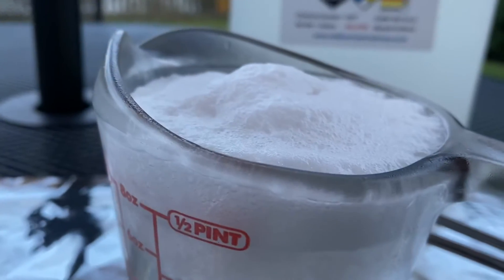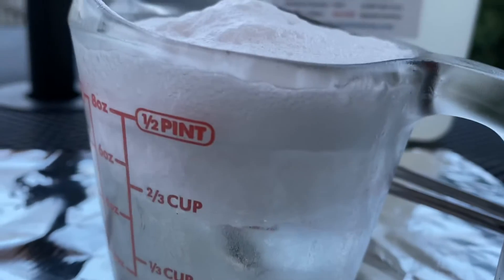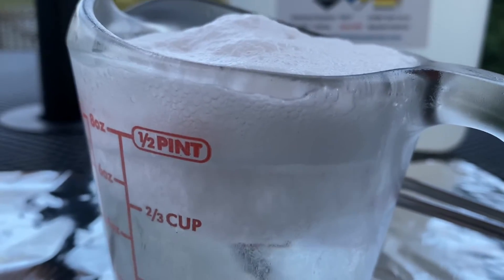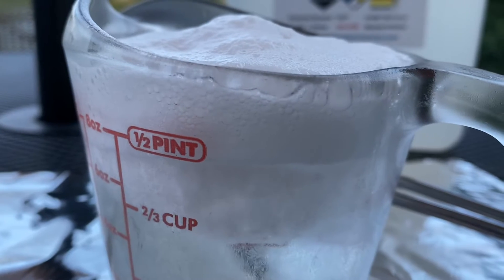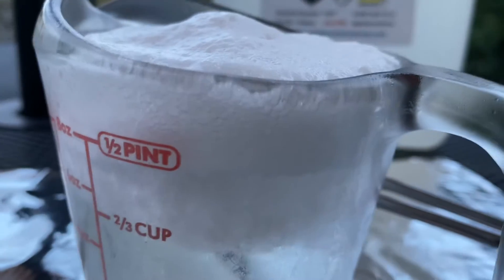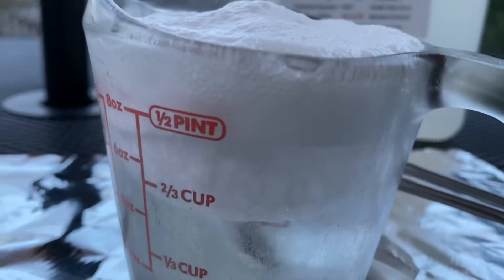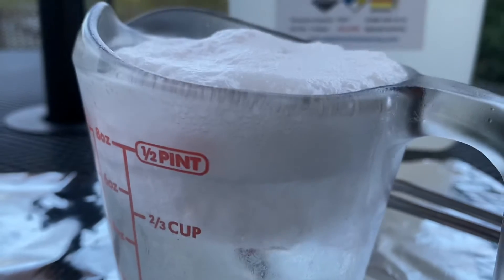And what you're seeing right now is the decomposition of that calcium carbonate into calcium chloride, carbon dioxide gas, and of course water.